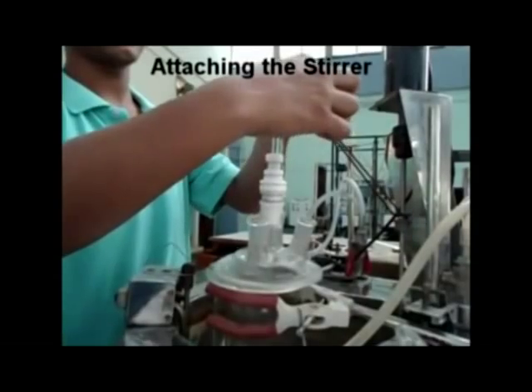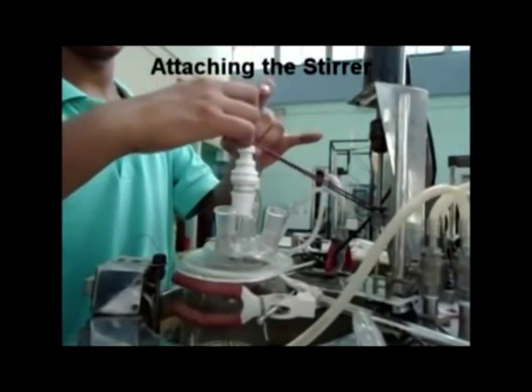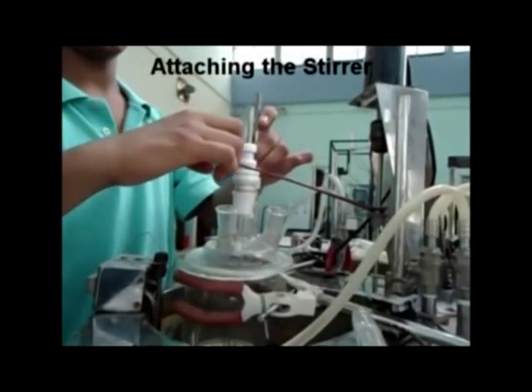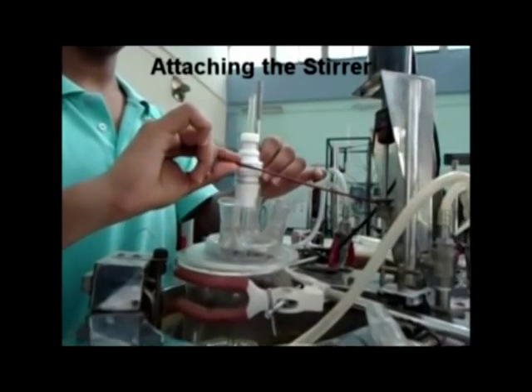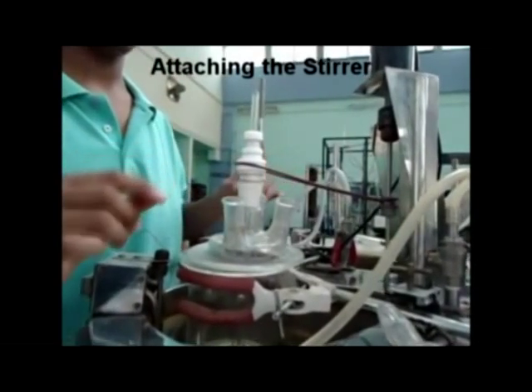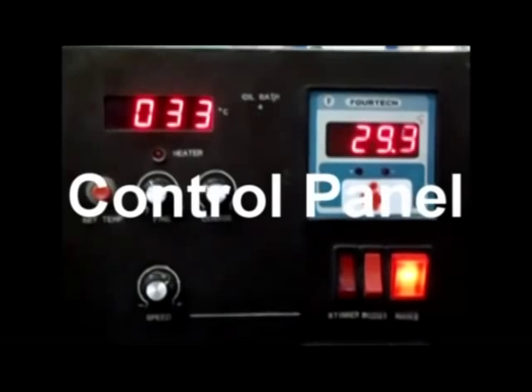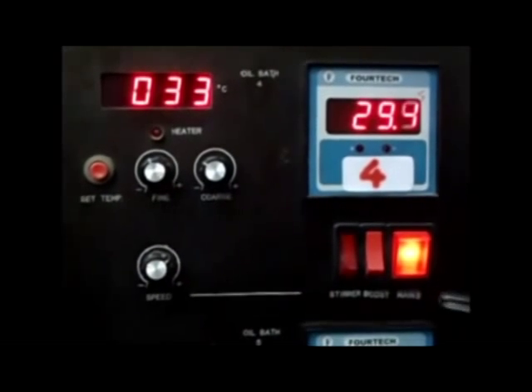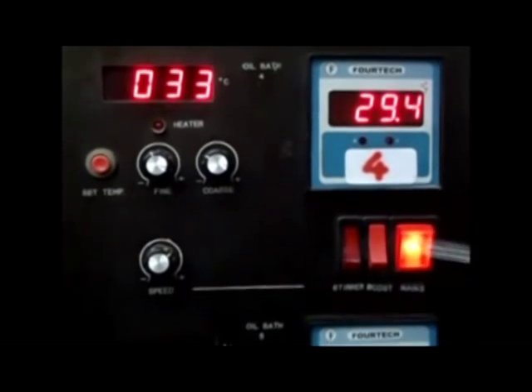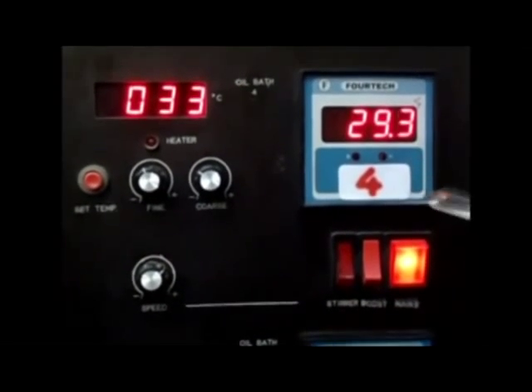Attach the stirrer rod with the ring. Adjust the height of the stirrer such that it is dipped into the reactor and no splashing occurs. This is the panel using which you can control the temperature, the stirrer, and its speed.